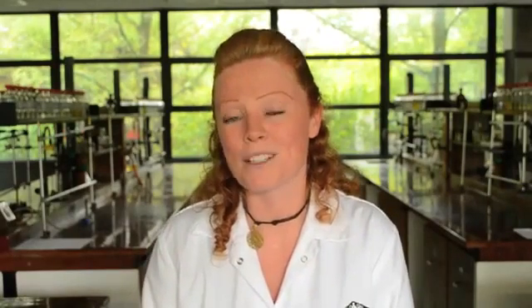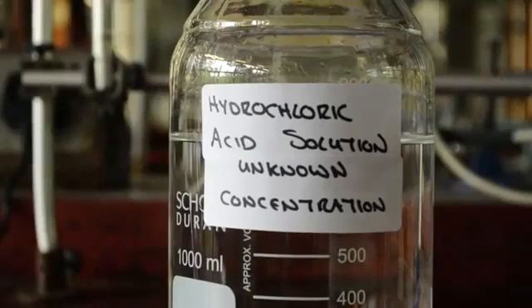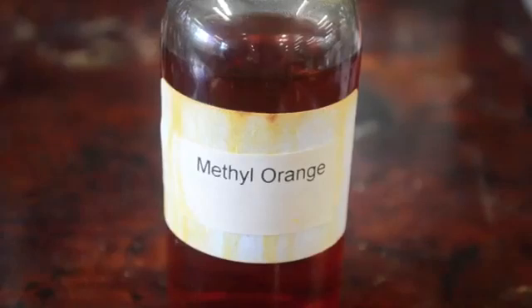In this titration, we will use a standard solution of sodium carbonate to standardize a solution of hydrochloric acid of unknown concentration. We will use methyl orange as the indicator.